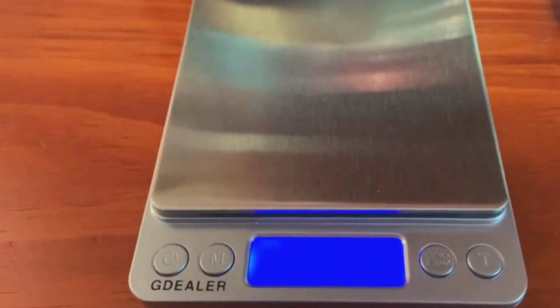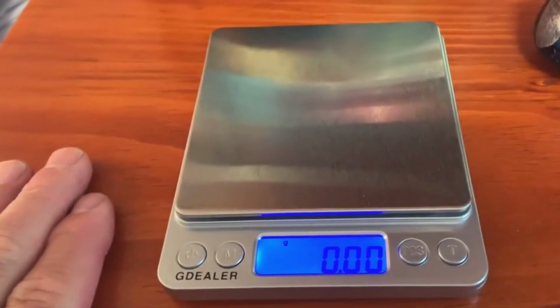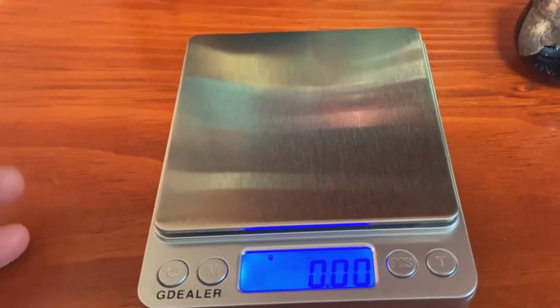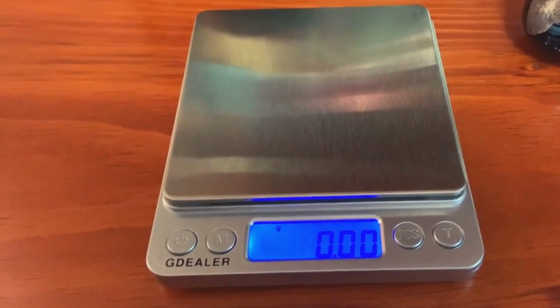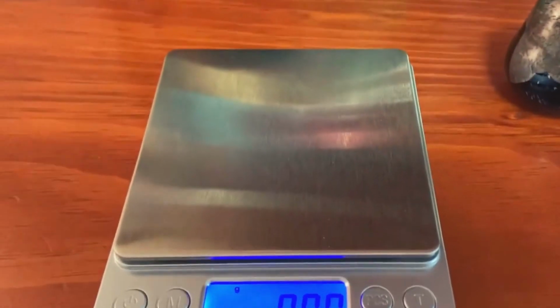And the whole reason why we're doing this experiment is we want to know how much we can trust the balance. If I weigh this object multiple times, how often am I going to get the exact same value, and to what degree is that value going to vary from data point to data point, or massing to massing.